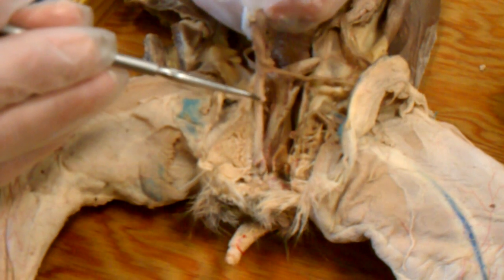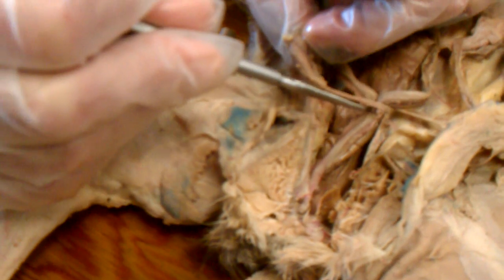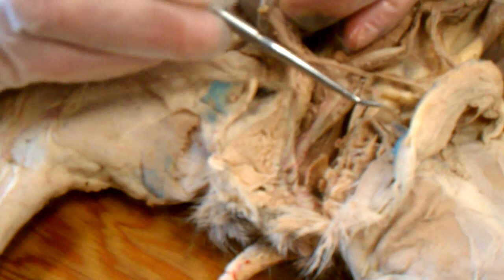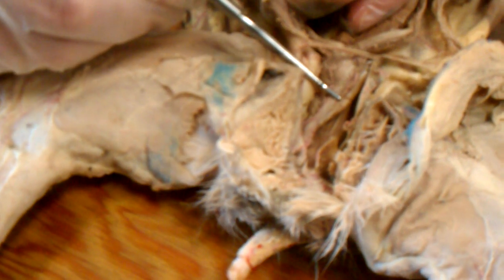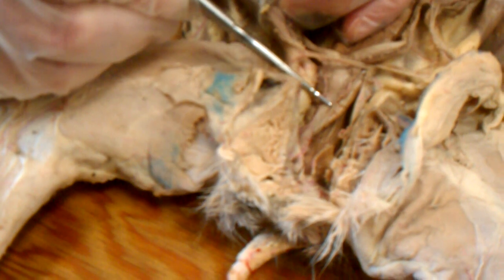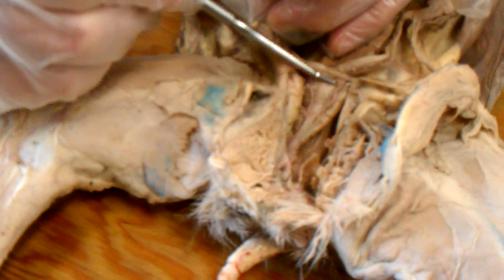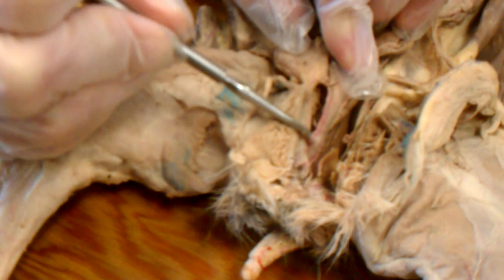Posterior to that, and we've cut through the lateral ligament of the urinary bladder to show the reproductive structures more clearly. In the center here was the body of the uterus, and just about at the beginning of the pelvic canal, an inspection of that tube will reveal a little bump, which is the cervix of the uterus, the neck of the uterus, and that's the dividing line then between the uterus and the vagina, which continues and passes through the pelvic canal.